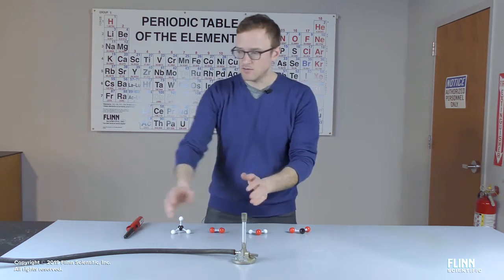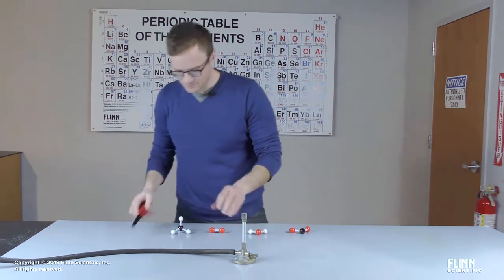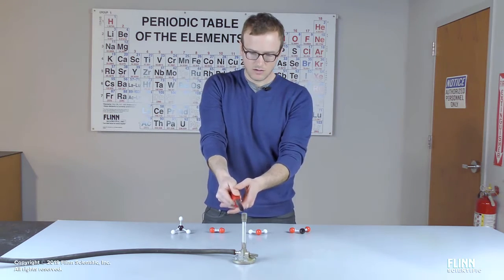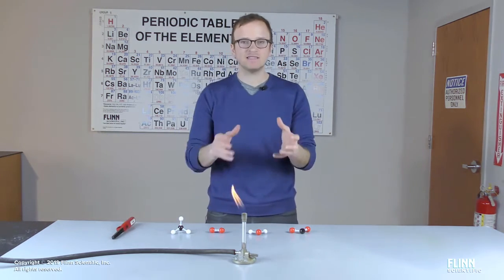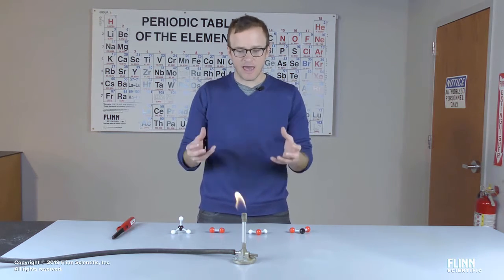I'm going to burn methane here. So, I'm going to turn on my gas, give it a spark, and now I am burning methane. I'm reacting methane molecules with oxygen gas.